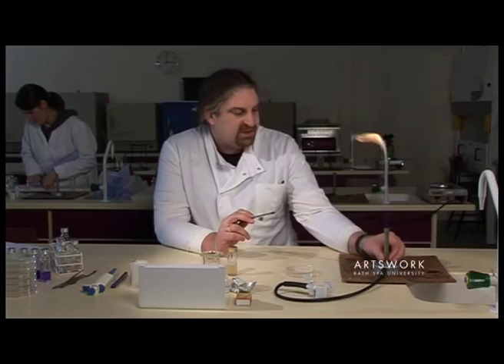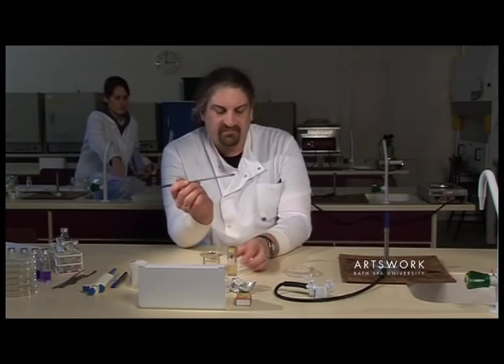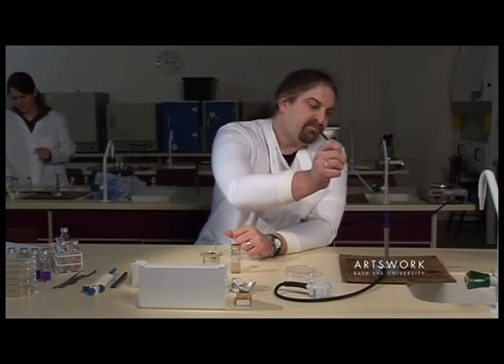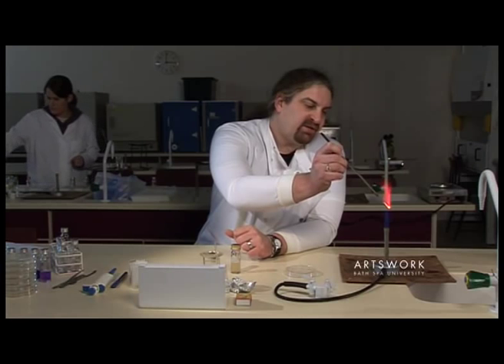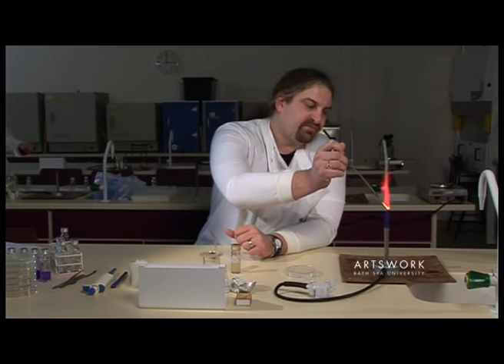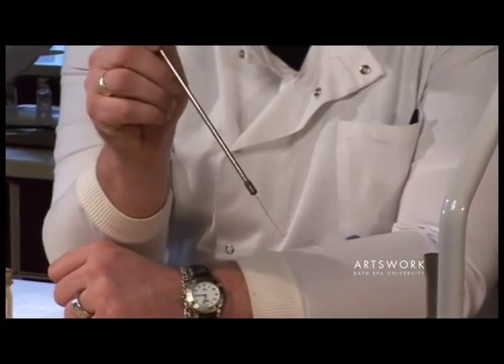We start by selecting our culture using a wire loop. Sterilize the loop in the flame, making sure it's red hot.